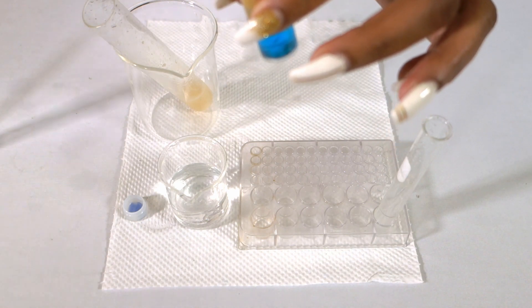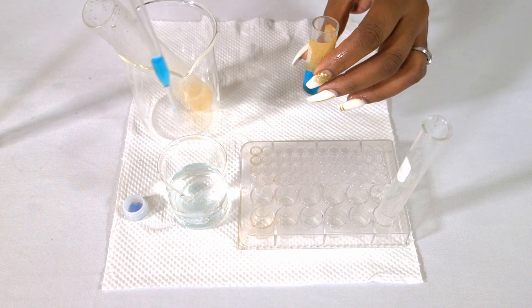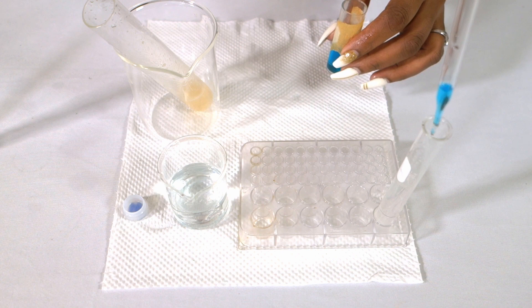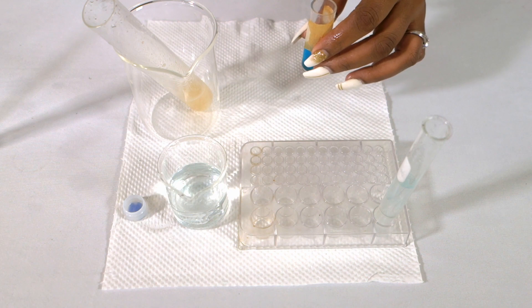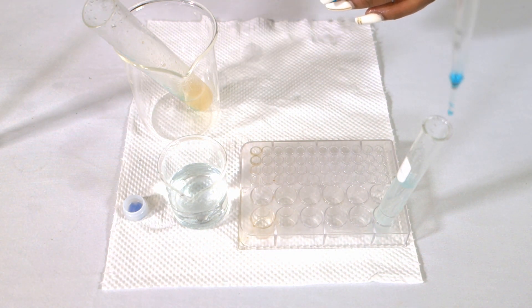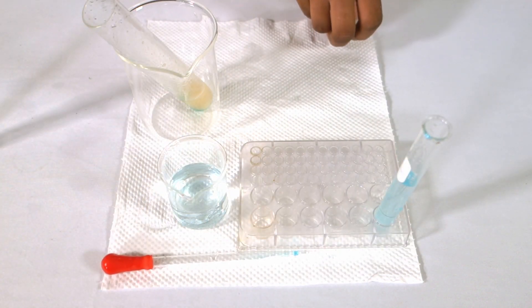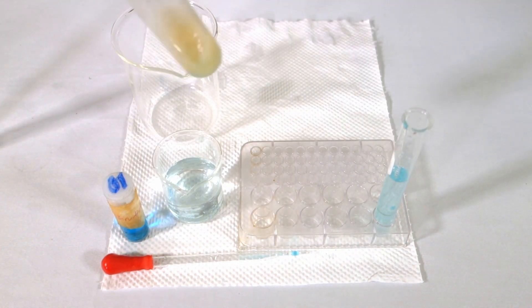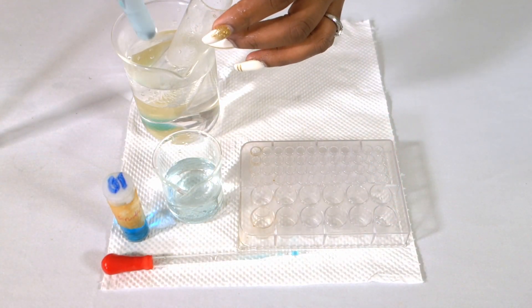We will first add the Benedict's solution to the water, which is our control, after which we will go ahead and add the Benedict's solution to our glucose solution. Once we add it to our glucose solution, we then move to our banana mixture where we pour a few drops of the Benedict's solution there as well. Once we do this, we put them in a water bath and wait for the color changes to occur.